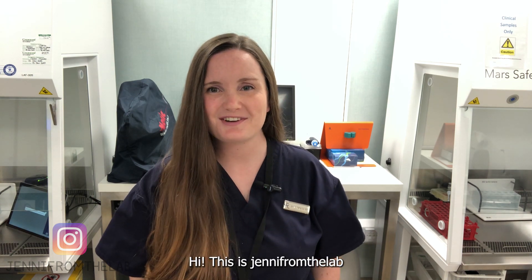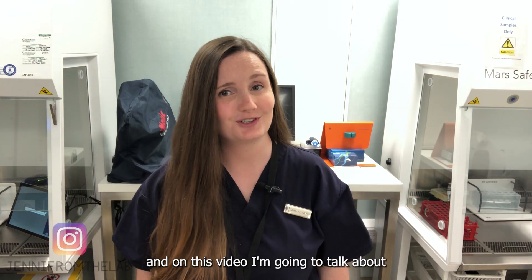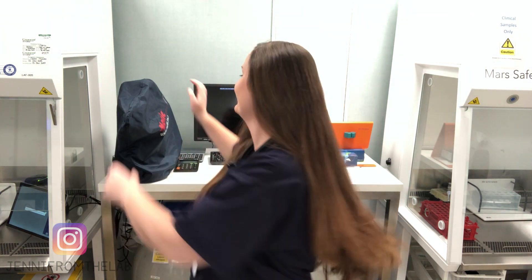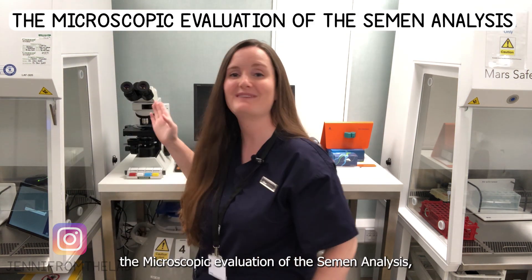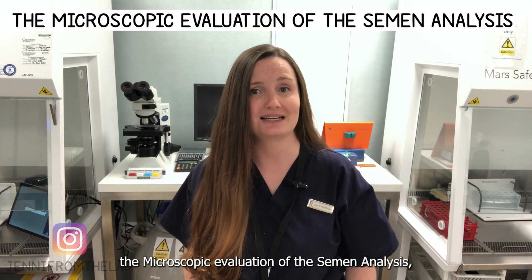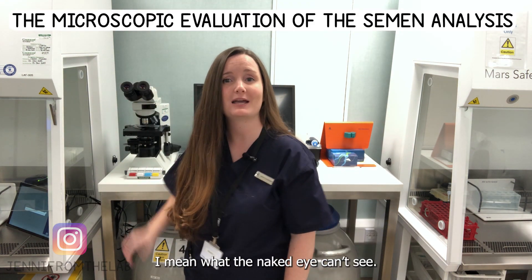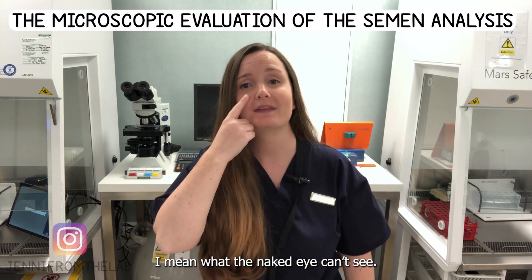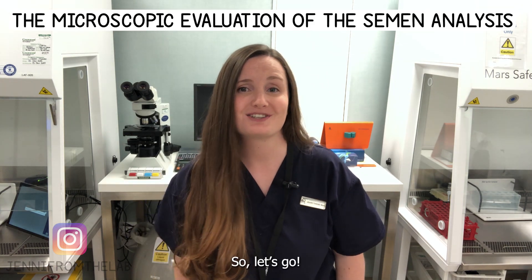Hi, this is Jenny from the lab, and in this video I'm going to talk about the microscopic evaluation of the semen analysis — and by microscopic I mean what the naked eye can't see.